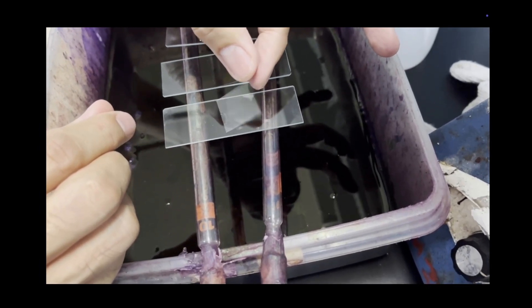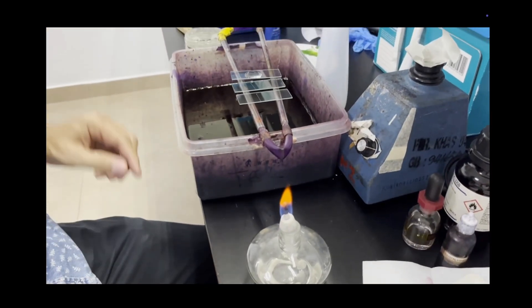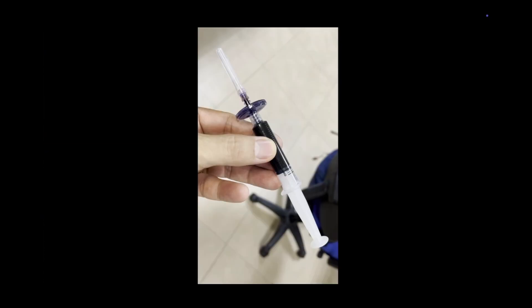We'll let the slide stand for about five minutes. Next the Ryu stain is prepared.